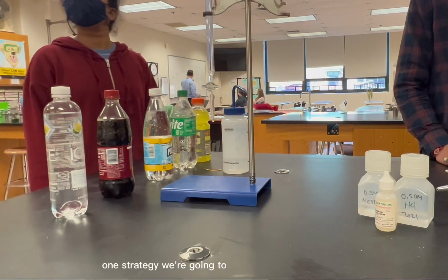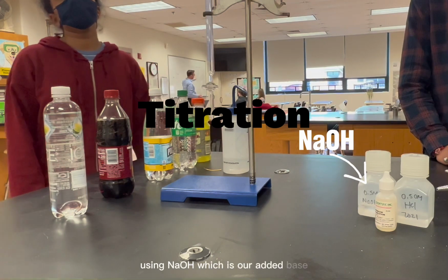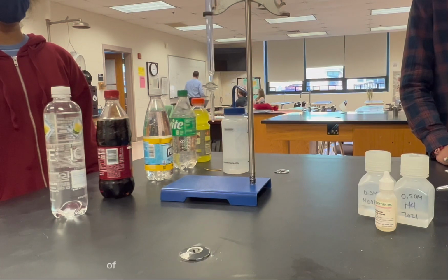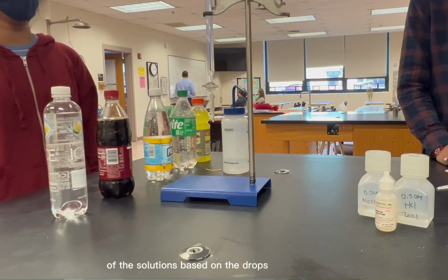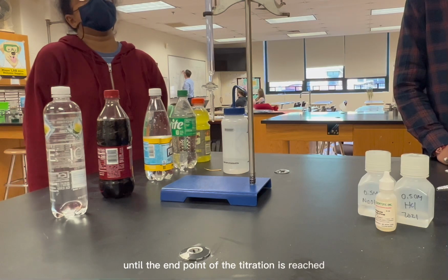One strategy we're gonna be using today is titration using NaOH, which is our added base. We're going to be determining the acidity of the solutions based on the drops of NaOH added until the endpoint of the titration is reached.